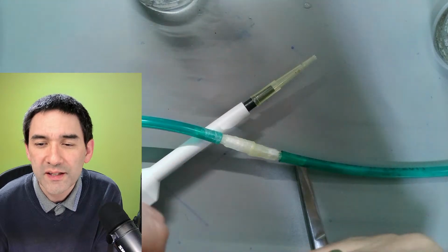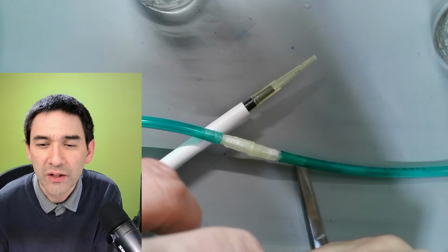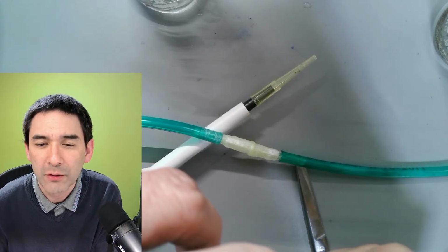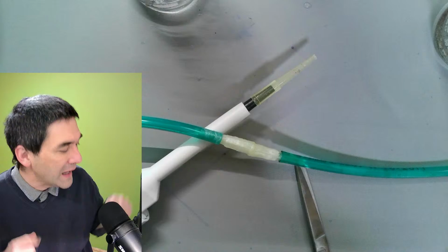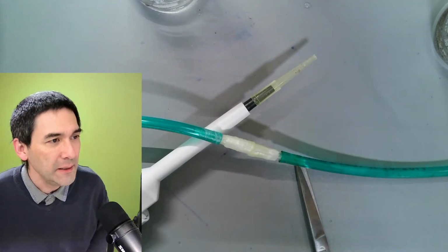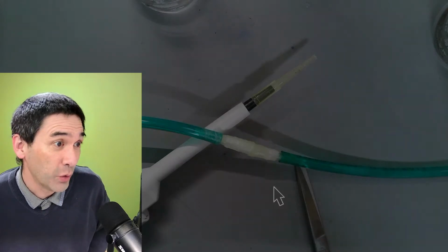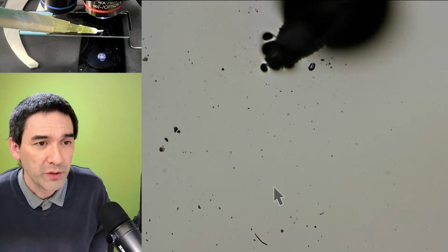Maybe seal off the sticky end of the tube and fold it up to push the air out. Then release the fold to give the amount of suckage defined by the amount of folding. I understand exactly what you mean, and I tried that already, and it didn't work. At least it didn't work all the time. Just want to show it to you.